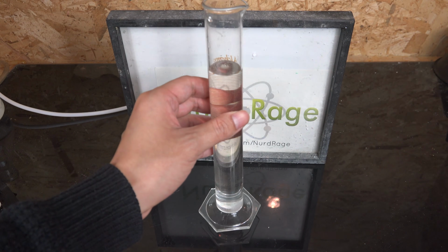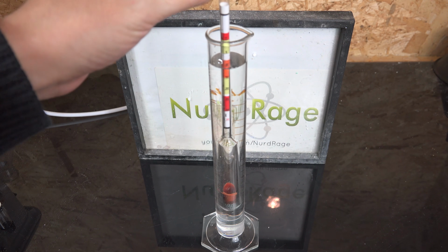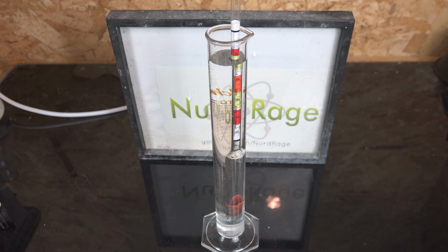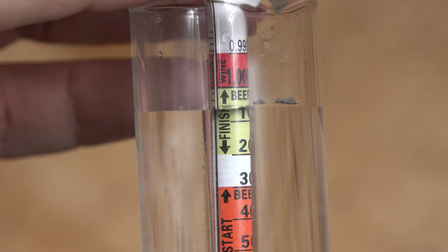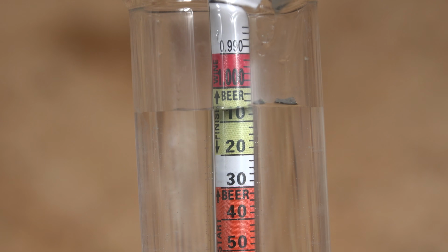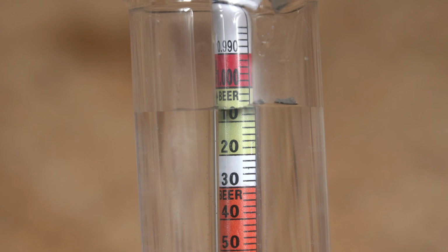Using one of these is very easy. All you do is carefully let it sink into the fluid you're measuring, and it helps to use a graduated cylinder to hold it. Make sure the container is deeper than the length of the hydrometer, and don't drop it in or it will smash into the bottom and break. Anyway, it's designed to float, and the scale is calibrated to indicate the density where it meets the fluid surface where we read it off. Here, the fluid has a density of about 1.006 grams per milliliter. And that's it. These are tremendously convenient in that they very quickly give you density measurements in just seconds, and you don't need to run calculations. You can just read the density right off the scale.